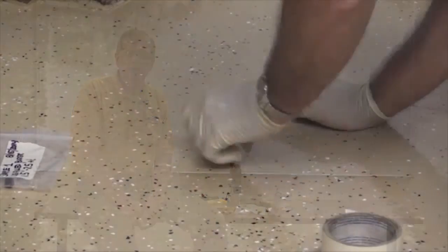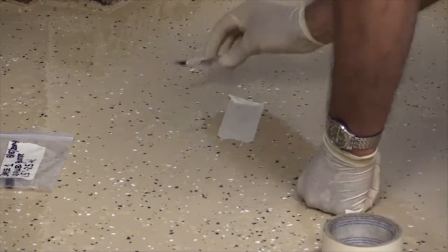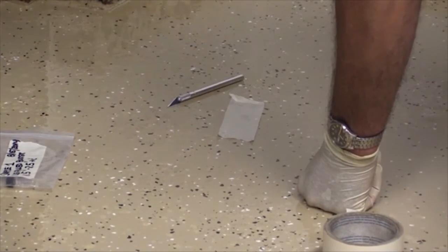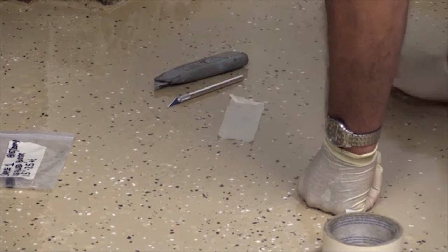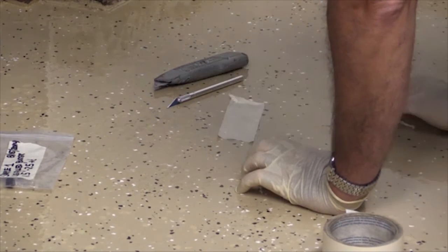Here, the removal of samples is being demonstrated. First, a blister cap in a failing area is removed. What I want to do now is try to use a small X-Acto razor knife or a regular standard razor knife, and I'm going to try to just extract that blister cap.